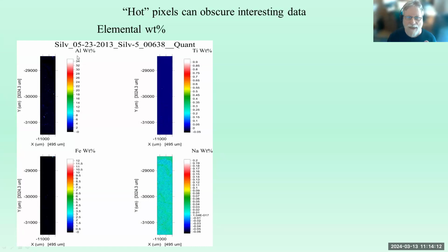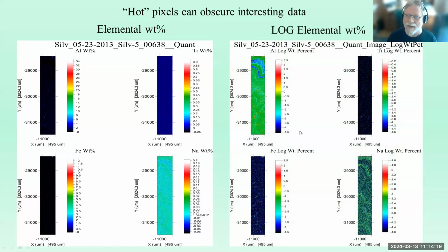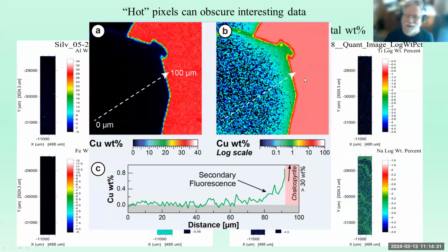And if I display this in normal weight percent units, we don't see anything interesting. But if I display the same data in log scale, all of a sudden we get all kinds of amazing detail. And that's because the hot pixel no longer dominates the palette here. And so this is in log weight percent, just pointing out some mapping things. And in fact, you can actually see really subtle things here, where you can see secondary boundary fluorescence effects in the log scale, which you wouldn't see in the normal map. And so this is a boundary effect from secondary boundary fluorescence here, which is kind of cool.